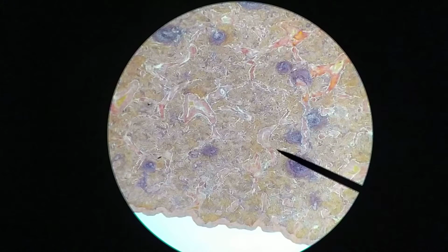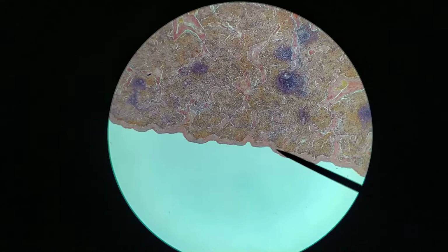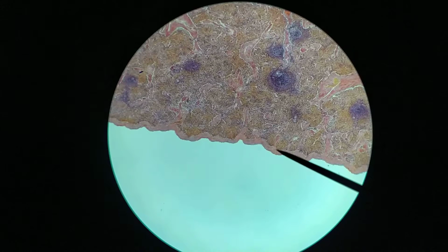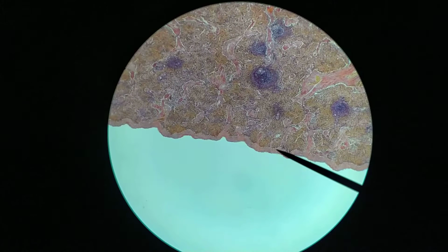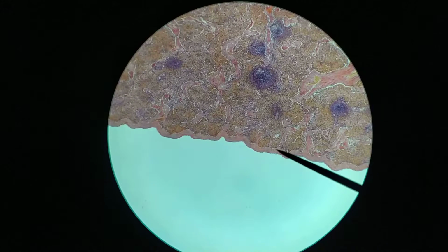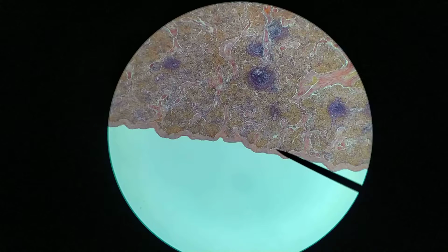Now just like the lymph node, it is a capsulated organ, so what you have out here at the edge is a dense irregular connective tissue capsule. In some cases it might look like it's a fibromuscular capsule, like it has smooth muscle in it. And that's partially at least because it will have blood vessels passing through the capsule into the interior. Okay, so what happens is that there is one blood vessel and one artery that comes in to the spleen at the hilus, and this blood vessel then splits off throughout the capsule and then enters into the interior of the spleen through the trabeculae.